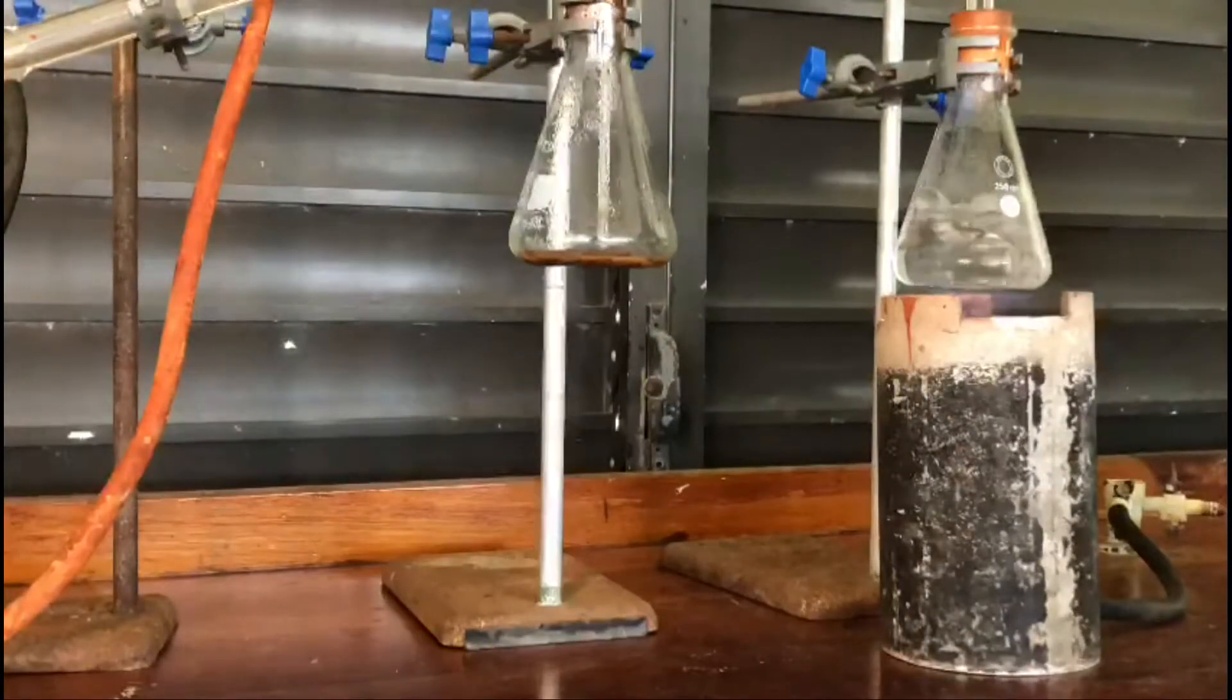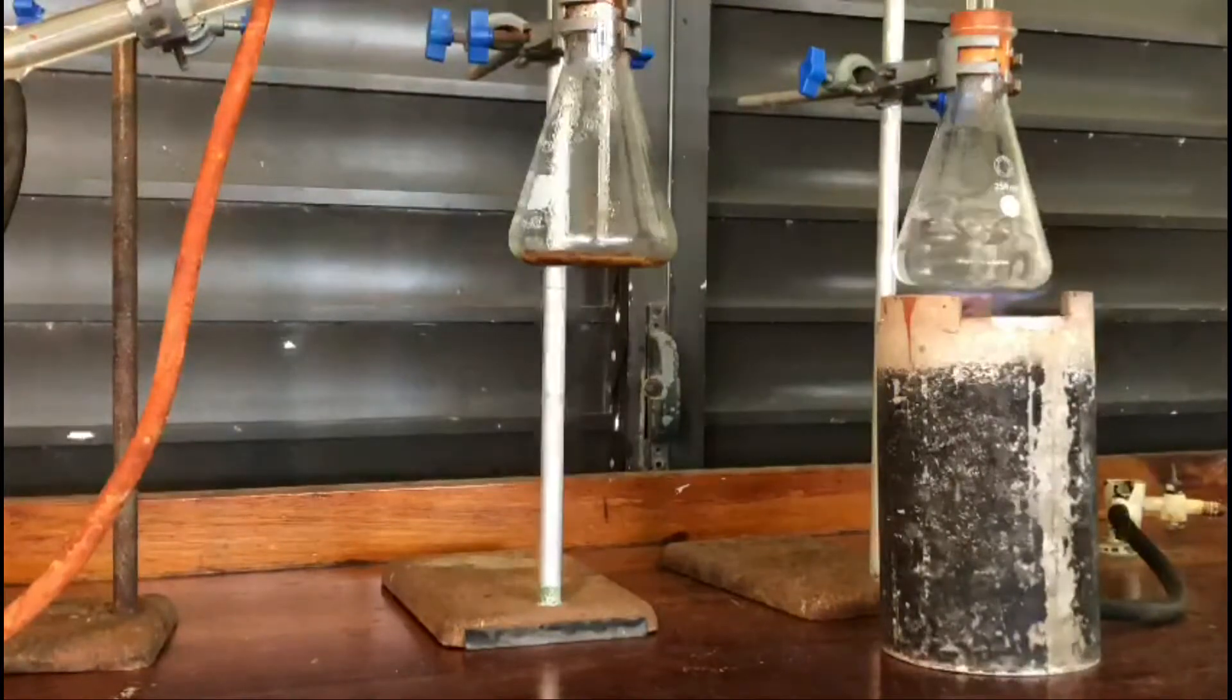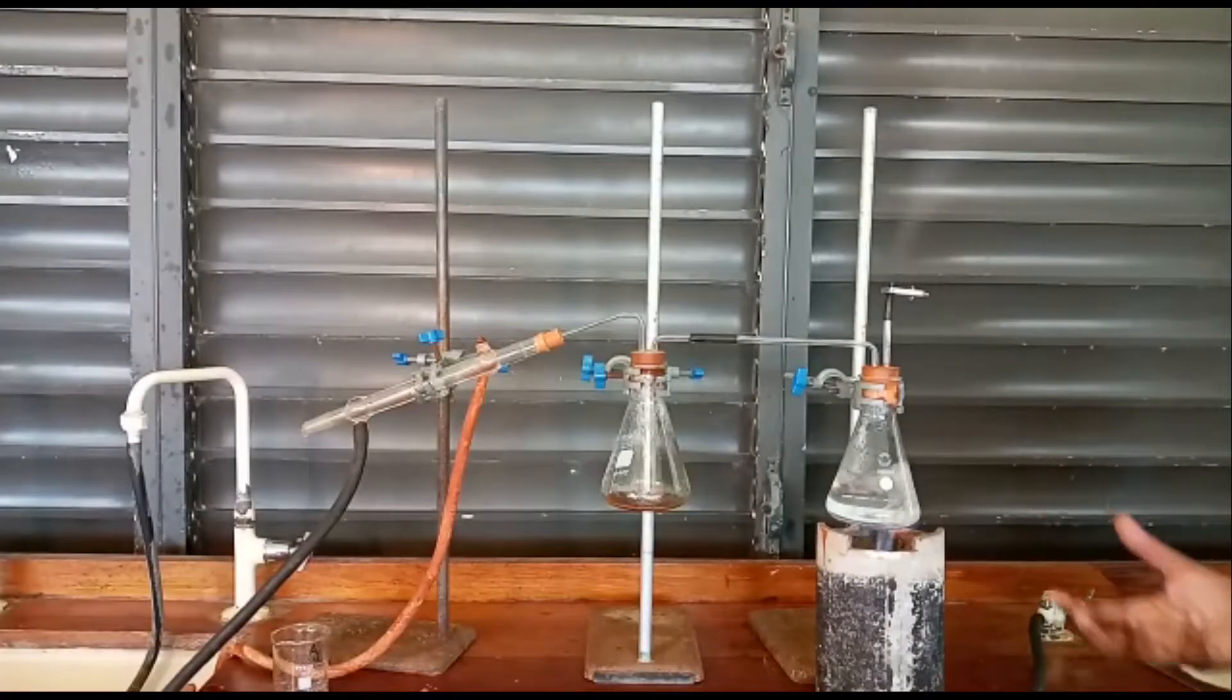In this conical flask, we have water coming to a rolling boil, and that's why we have all this bubbling going on in here.